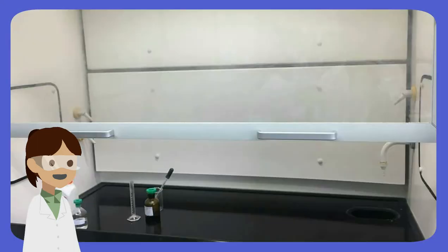For your information, this experiment will be conducted by using strontium instead of barium because barium is easily oxidized and harmful. Besides, we will perform the experiment on a very small scale in a fume cupboard. We are about to begin the experiment.